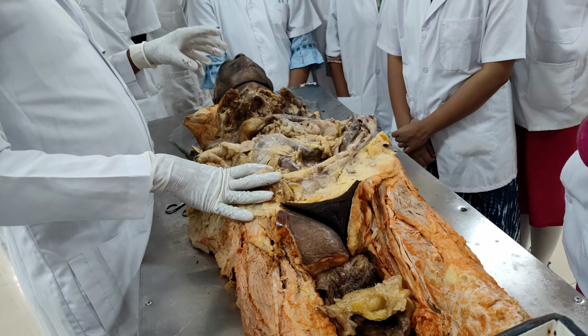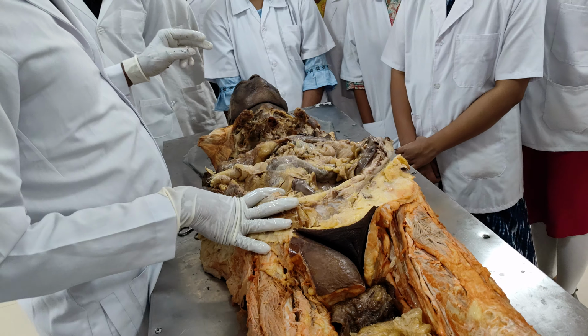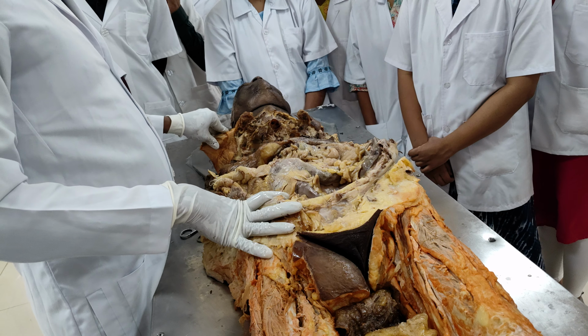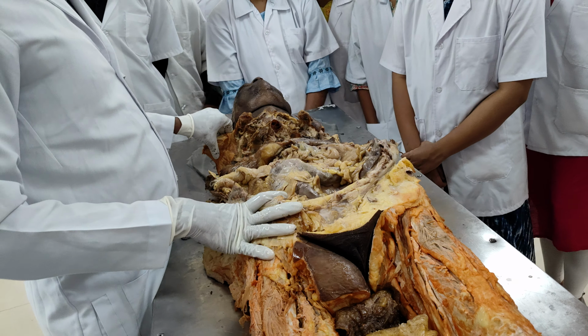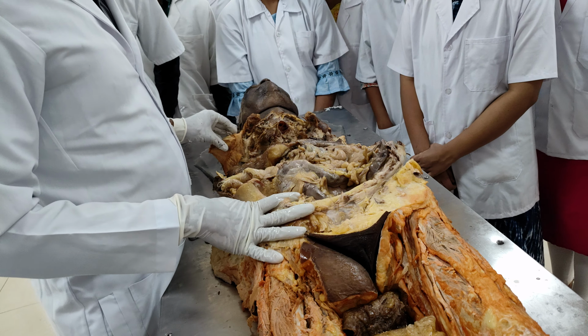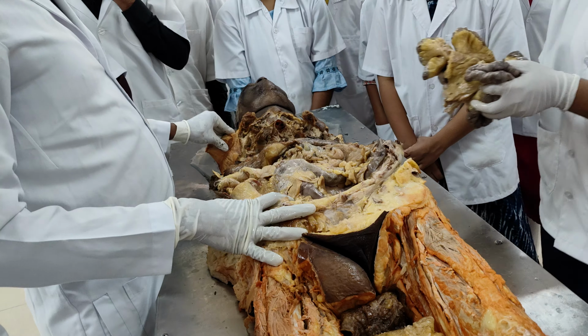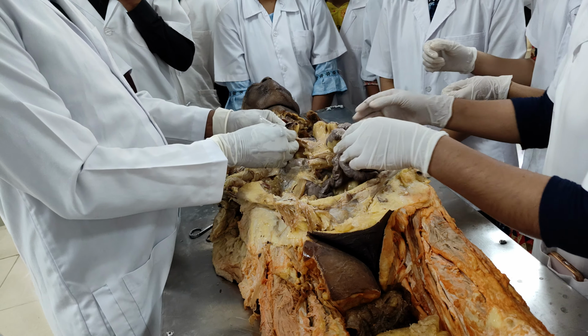So these are all the differences between the jejunum and the ileum. And there are two more characteristic differences between the jejunum and ileum. The first difference is, within these mucosal folds, you will be seeing under the microscope of the jejunum some structures called the villi. That is the microscopic villi, right?